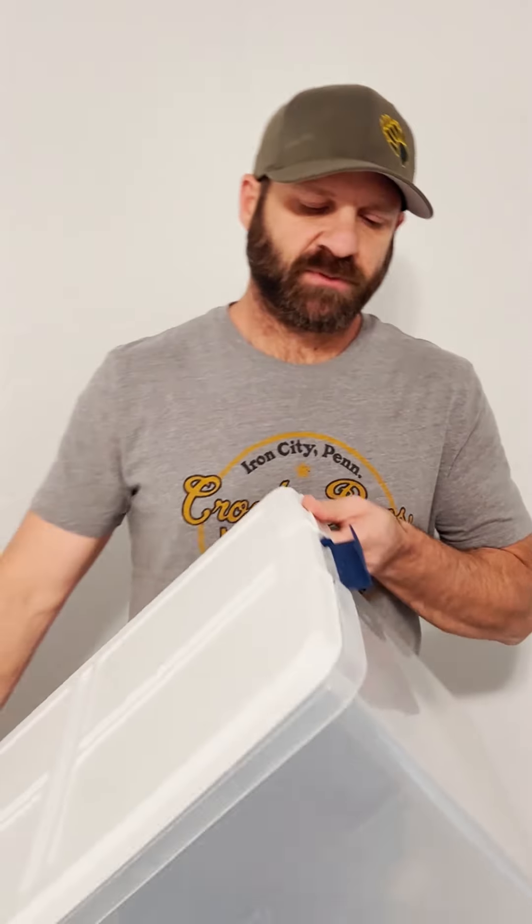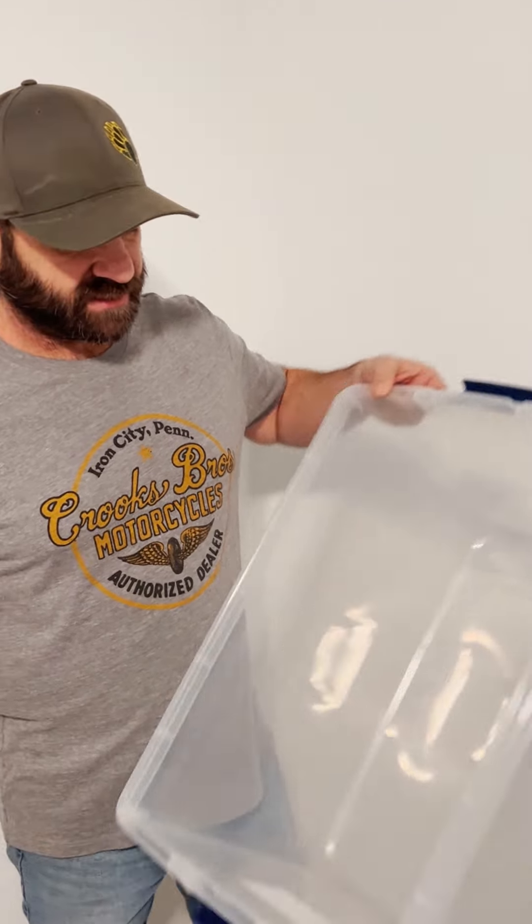Today we're going to make a still air box. It's a pretty simple contraption. This particular box I'm going to be using is a 66 quart tub. You can use anything 60 to 80, even 100 quarts — the bigger is honestly probably a little bit better. 100 quarts was a little too big, almost four feet across. This one was a little smaller than I needed; I would have liked an 80 quart. Nothing was available, so I got this one at Lowe's for $15.